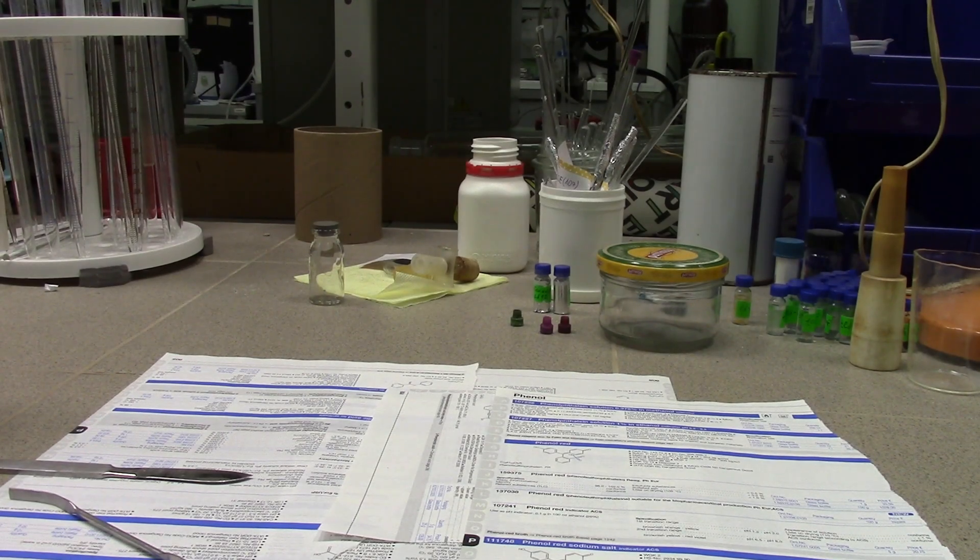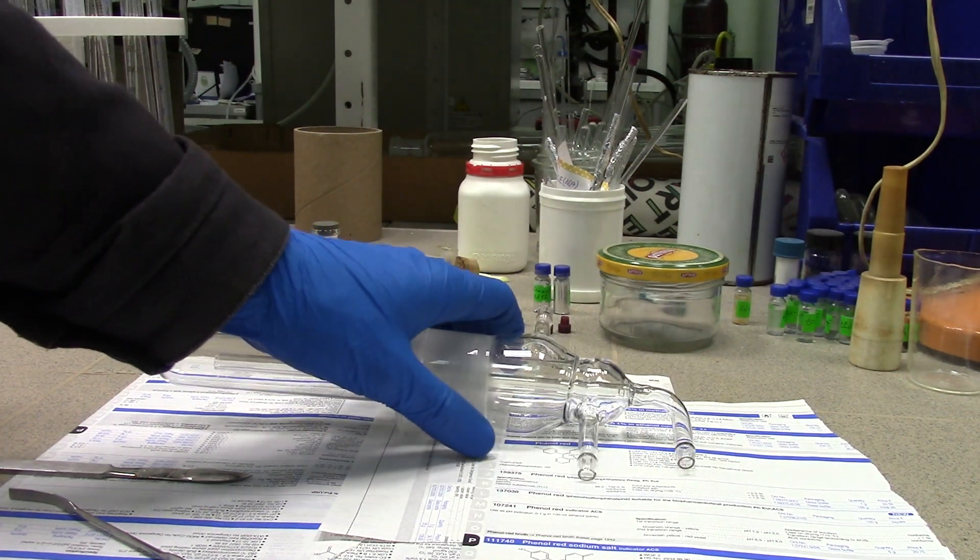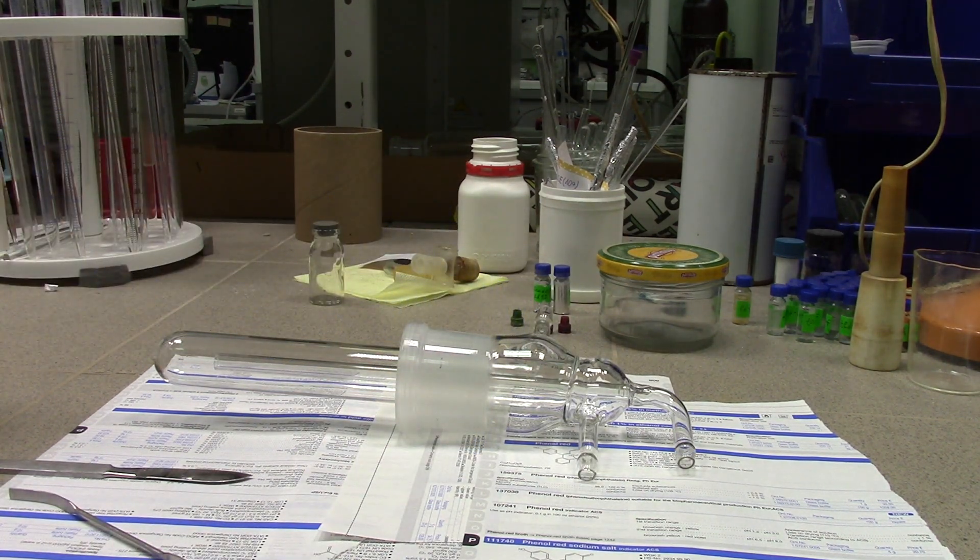Salute my dear chemists and welcome to Akantharok's channel. Today I'm going to show you how to perform purification using fractional sublimation.